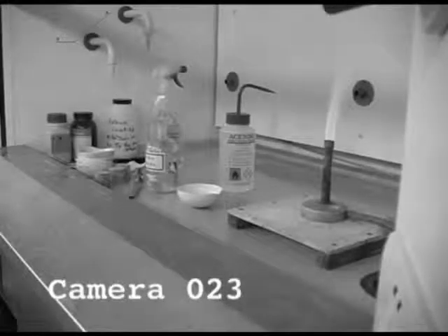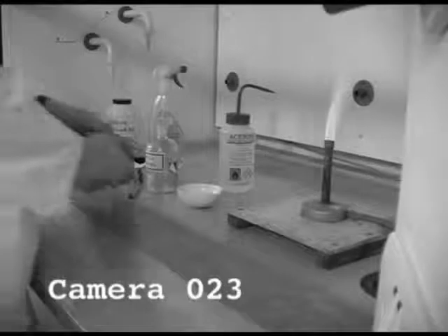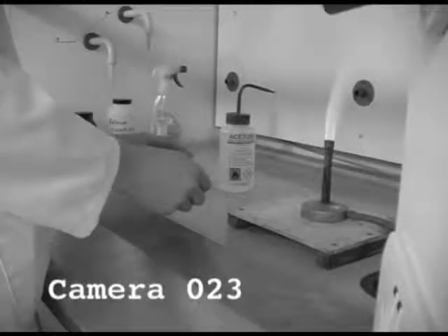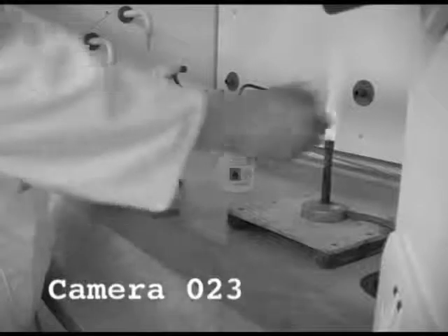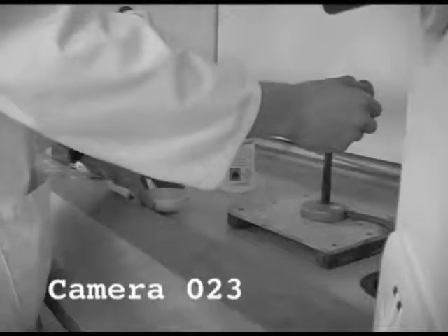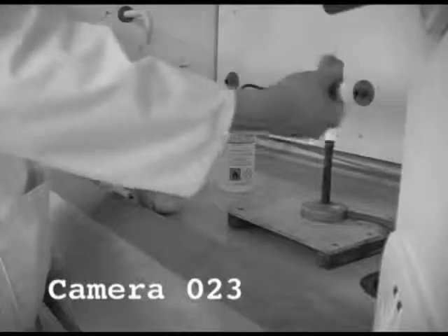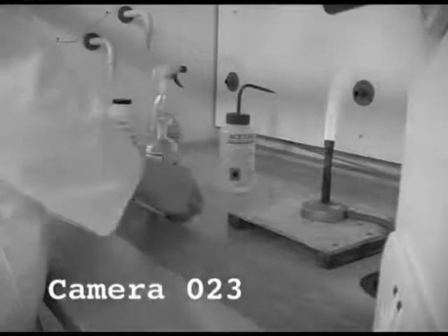Yeah. Now, here we see a Bunsen that has not been put on safety flame. It's been left on a roaring flame. And a highly flammable liquid right next to the Bunsen burner. I didn't actually see that. I didn't put that there. Should be looking more carefully.